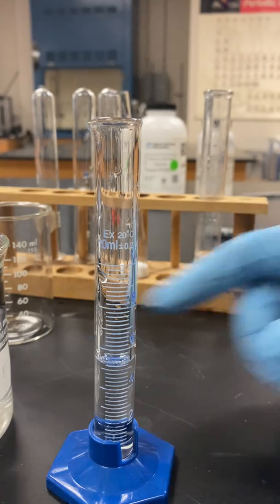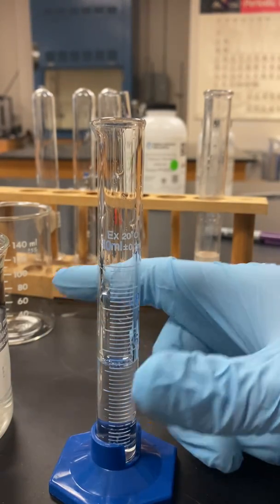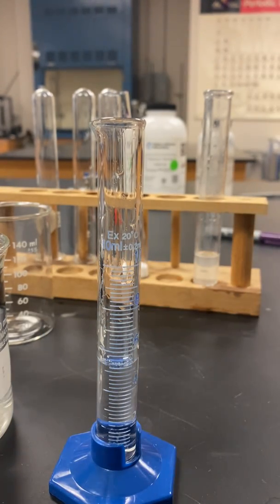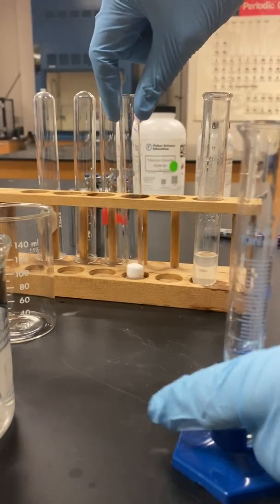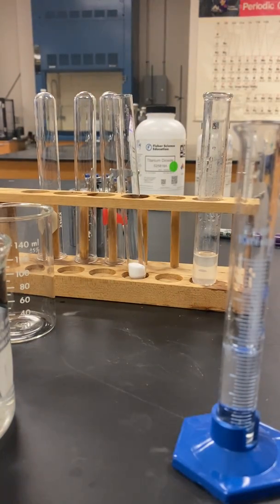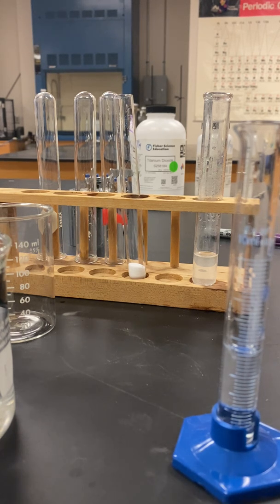Note the temperature - it feels like room temperature water. It's not too warm, it's not too cold. Within this test tube right here, I've added 1.865 grams of the potassium chloride.